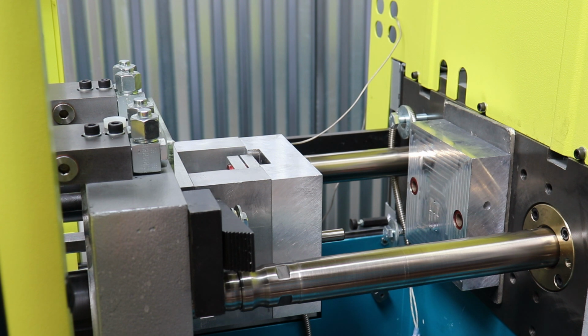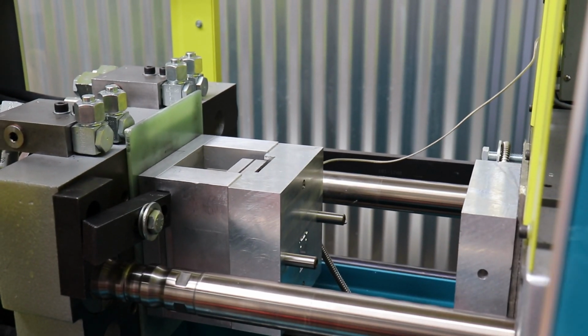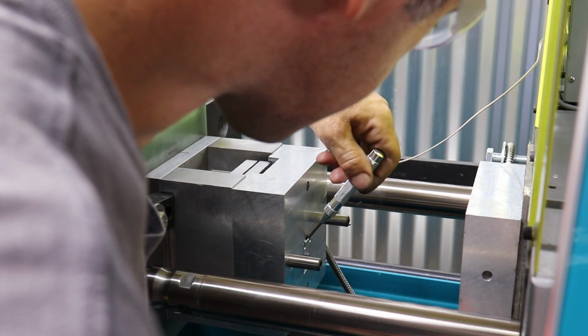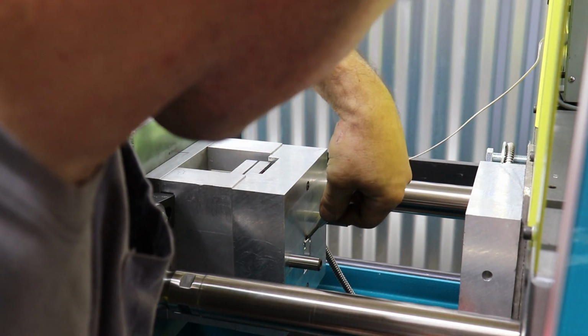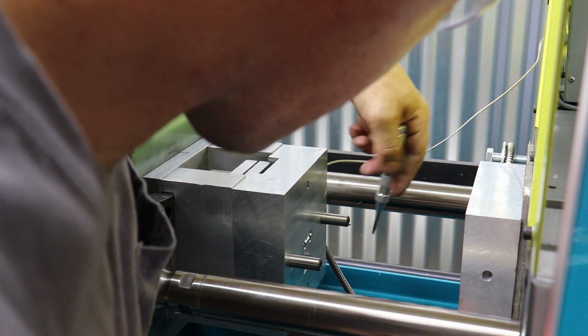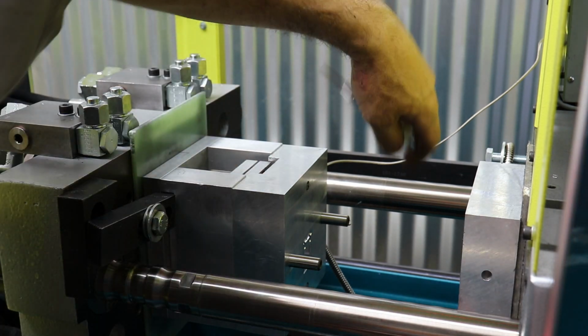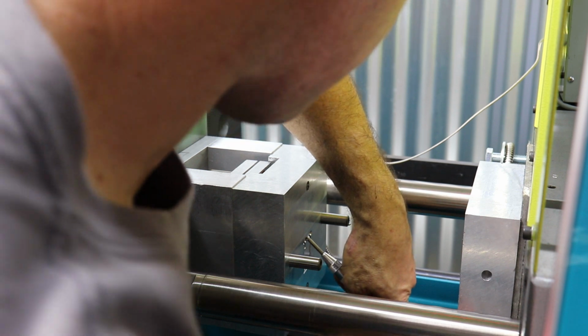I have a center punch, you know, for punching a hole for drilling. Here it is. This may be all we need to do. Let me switch sides here so you can see what I'm up to, because we're real close. So I am going to basically put a little undercut with this spring-loaded center, like that. And actually, I'm going to hit the emergency stop button. It's a good practice when you're messing between a mold with your hands to not allow the molding machine to crush your hand.